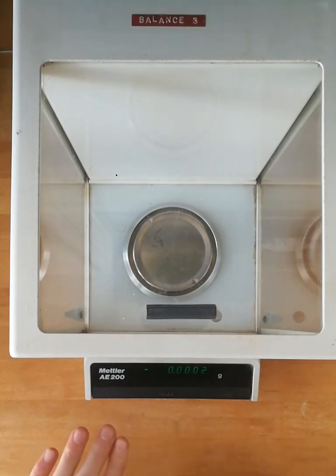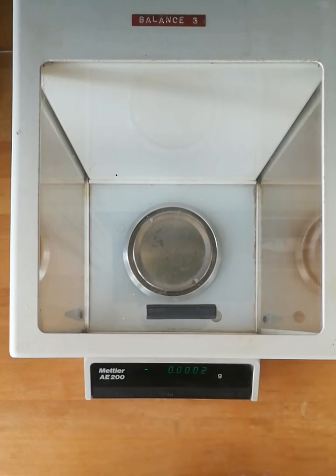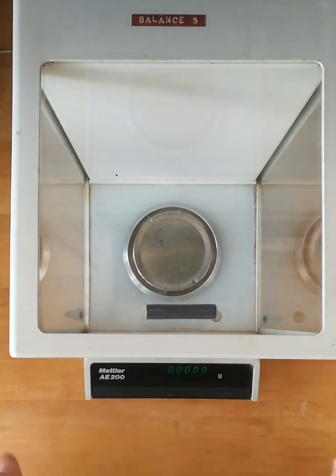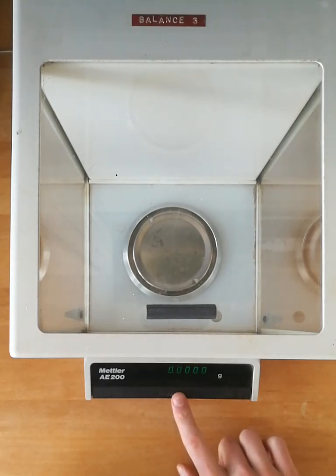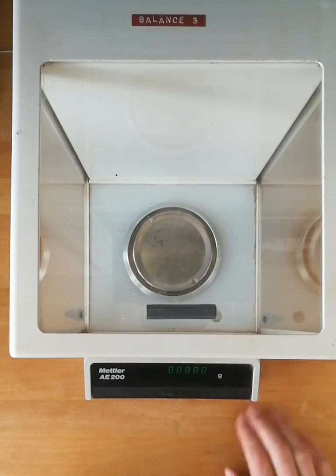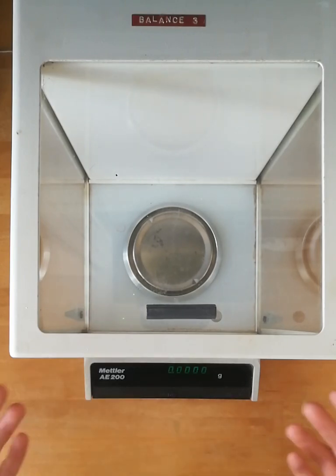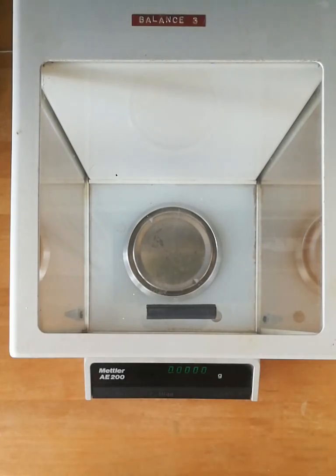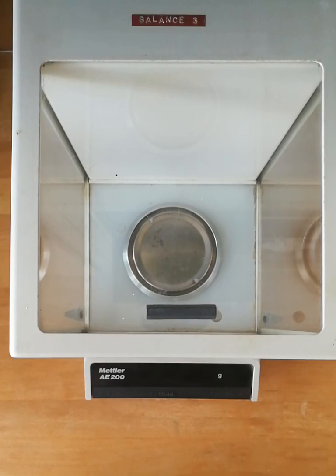We've got three buttons to control the balance: the re-zero or tare button to set the display to zero, the mode button in the center, and the on-off button on the right-hand side. You press it down to turn the display on and lift it up to turn it off.